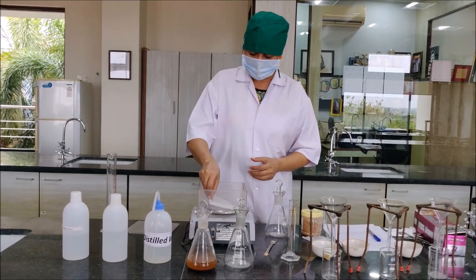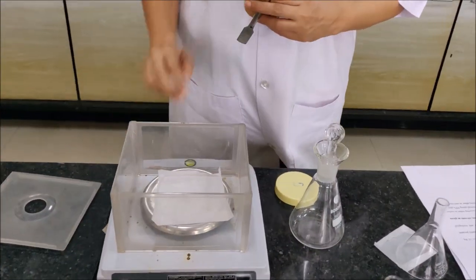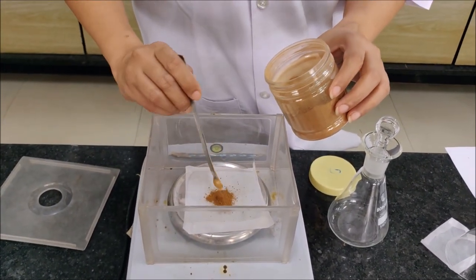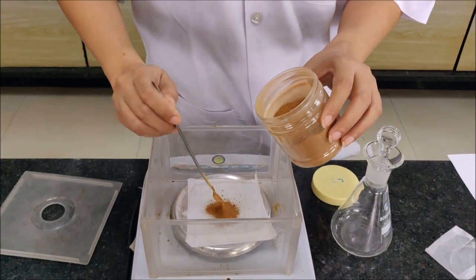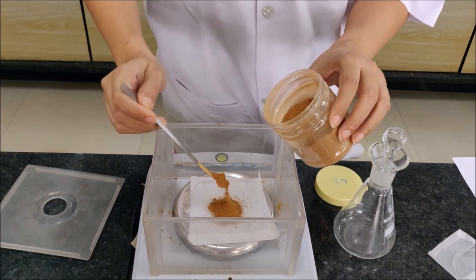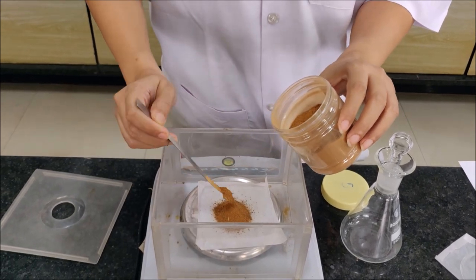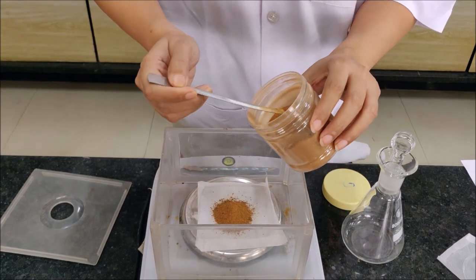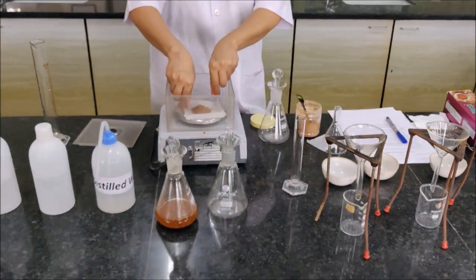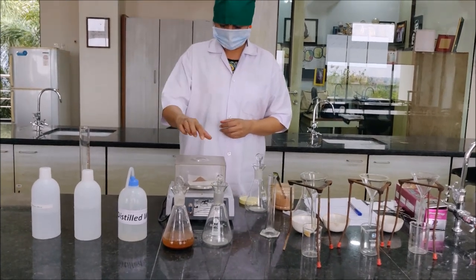The first step is to weigh 4 grams of powder. I will tare the weight of the butter paper and we will weigh 4 grams of the crude drug powder that we want to use for evaluation of extractive value. So here I have weighed exactly 4 grams of powder.